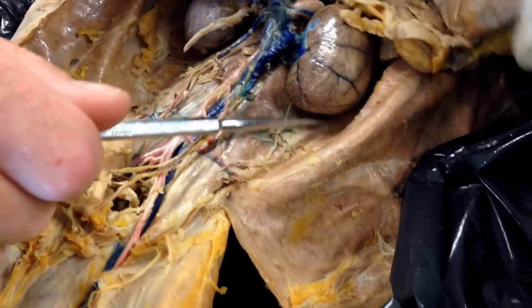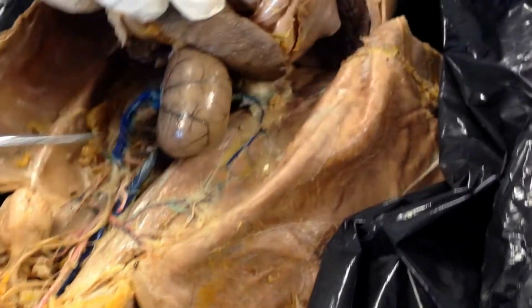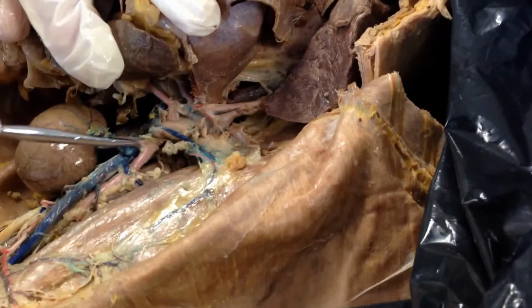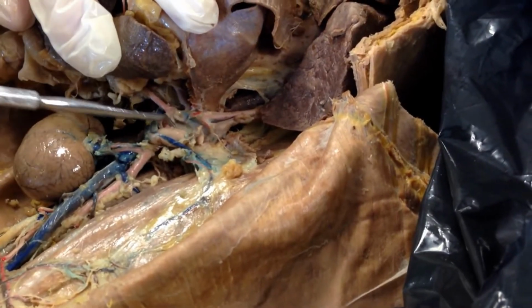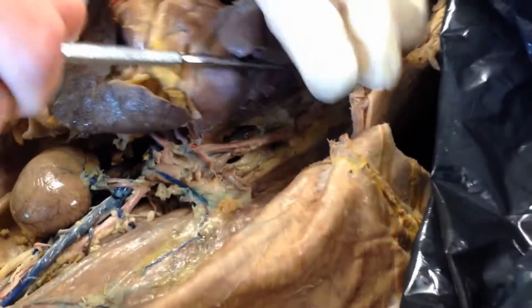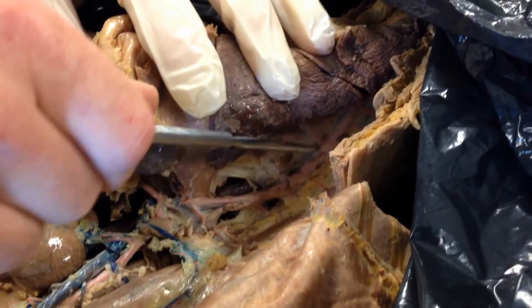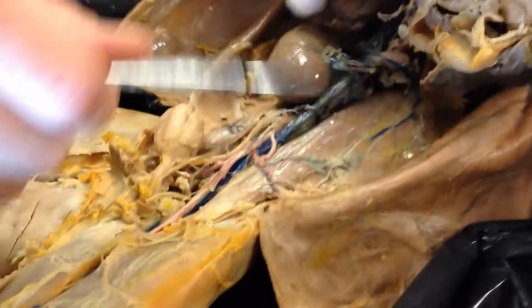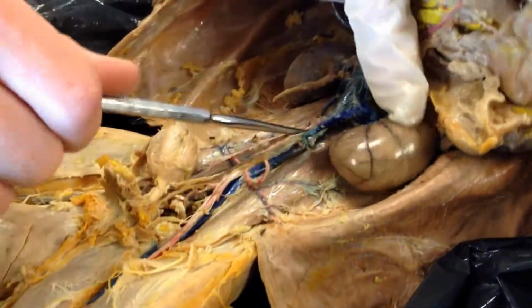And it really extends. If we pull all of this over, so I'm leaning everything over, this is still it wrapped around back here, going all the way up. I'm pulling on it so it's bent here. But then it continues right here. This is still the aorta, goes all the way up behind to the heart. Okay, so that whole thing is the aorta. But what we're going to focus on is the chunk that is down here in the abdomen.